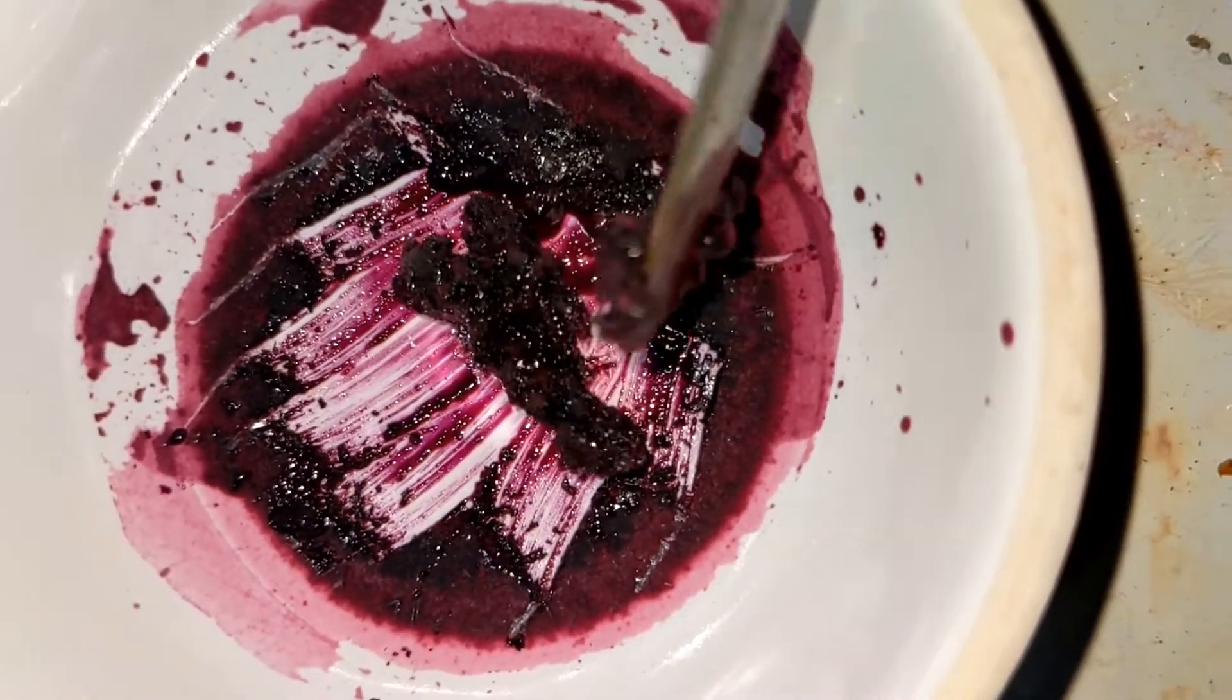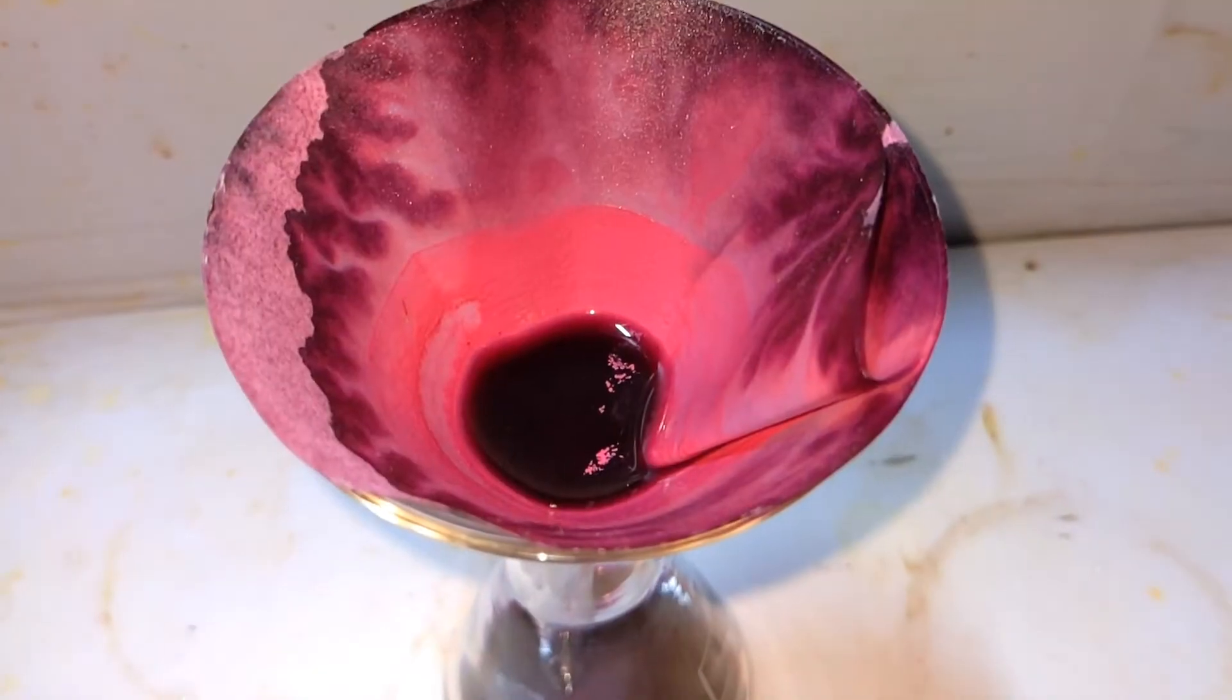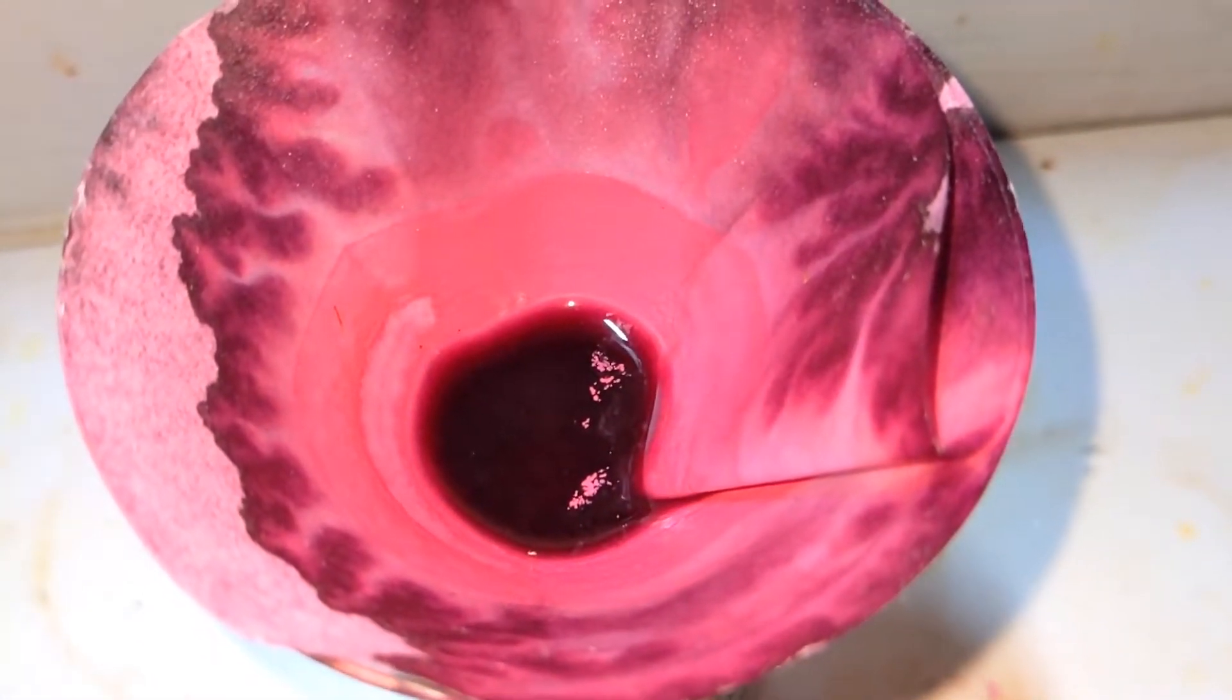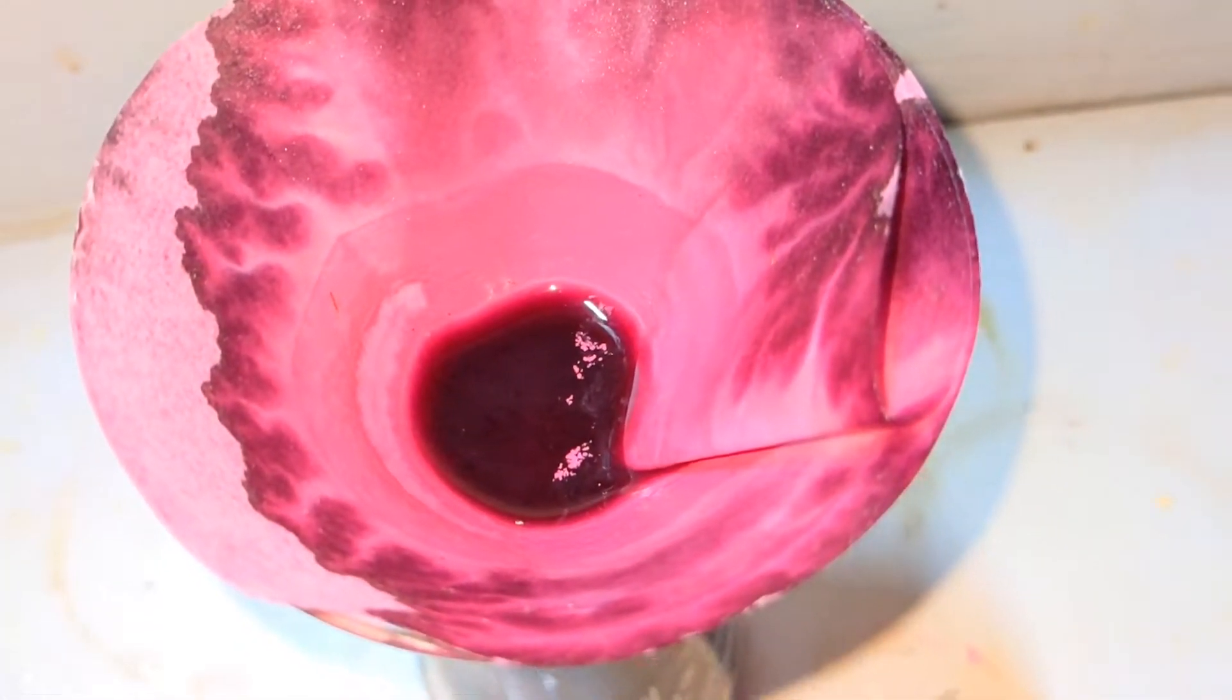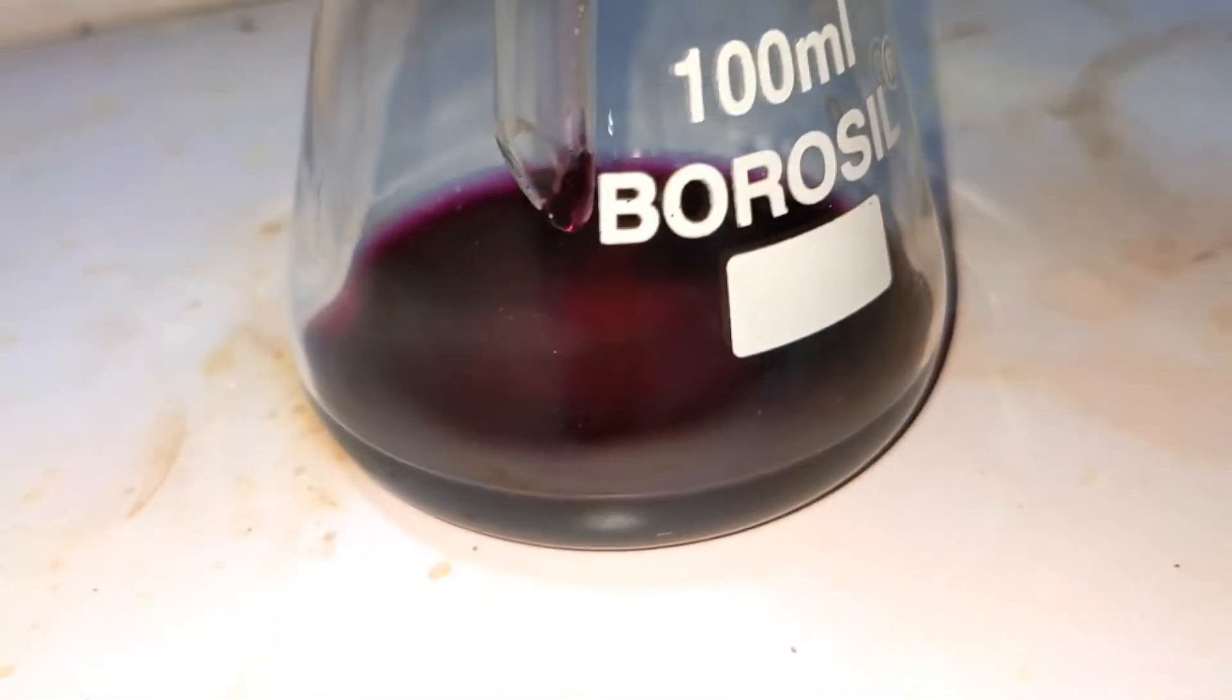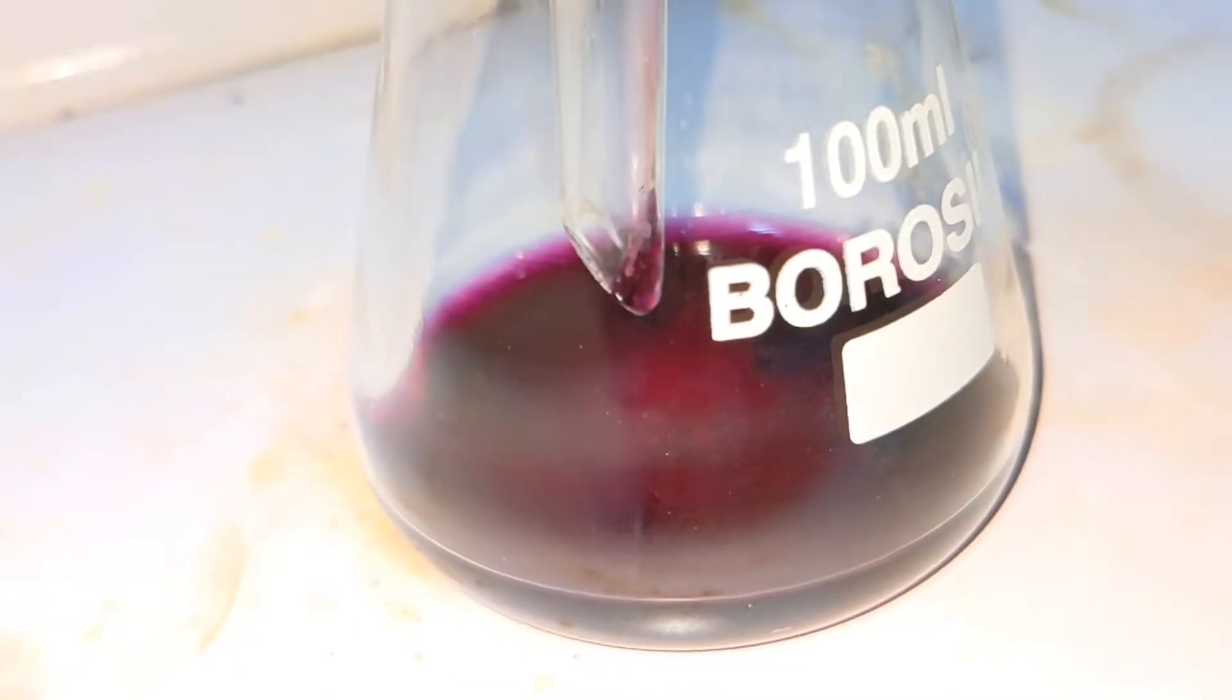So I tried to separate out most of the precipitate from the crystals. I did that by dissolving the compound in very little water, and the crystals are relatively much more soluble in water compared to the precipitate. The precipitate is the basic chromium-3-glycinate and it was then filtered off.